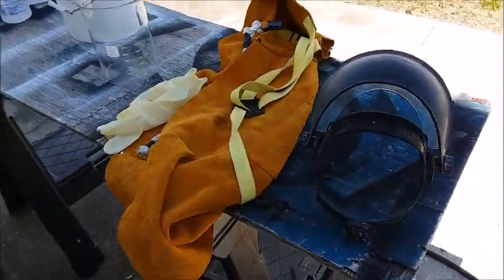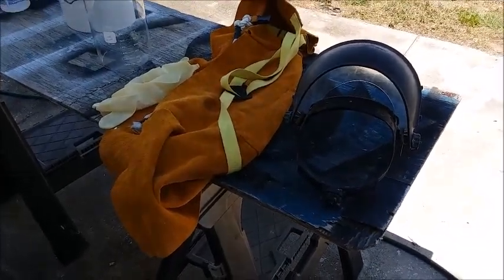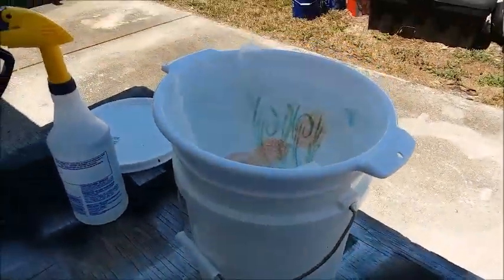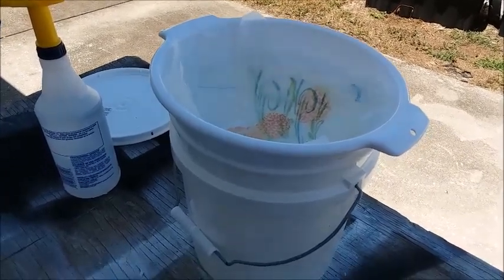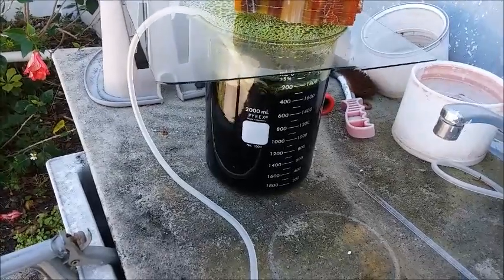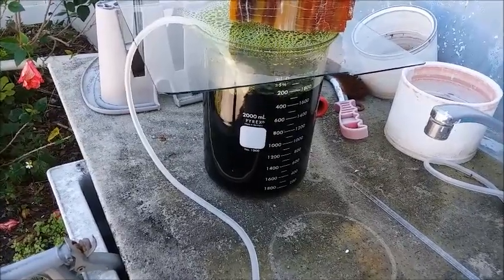Today I'm going to get my personal protective equipment on - my face shield, leather apron, and gloves. The lighting is pretty harsh out here. What I'm going to do is filter the liquid through, dump everything into the colander, then wash everything off. I'm going to keep this liquid.